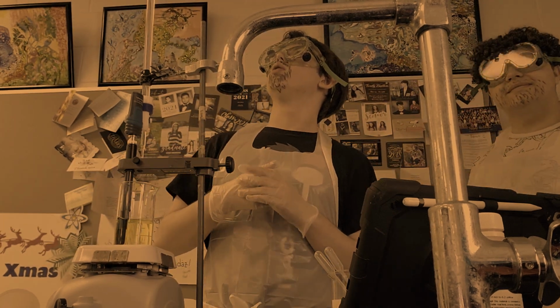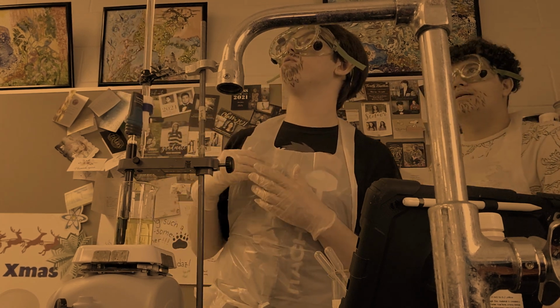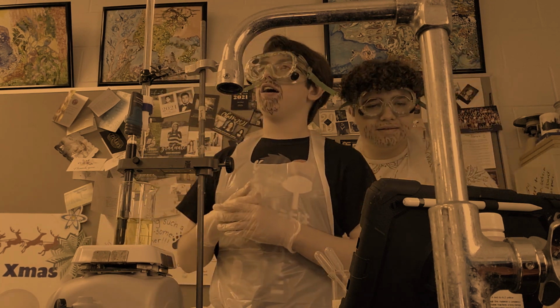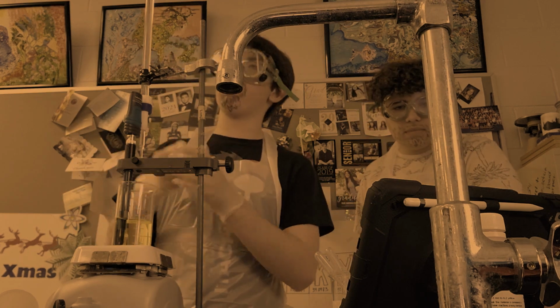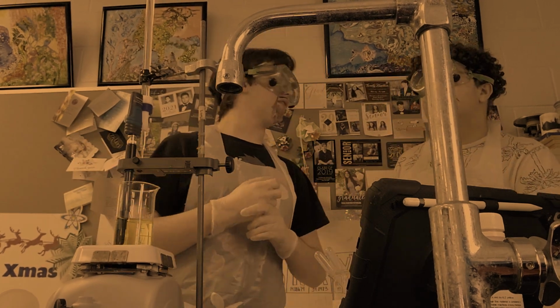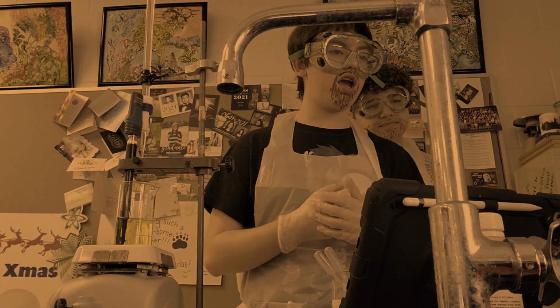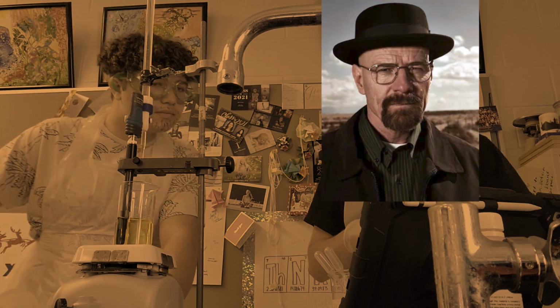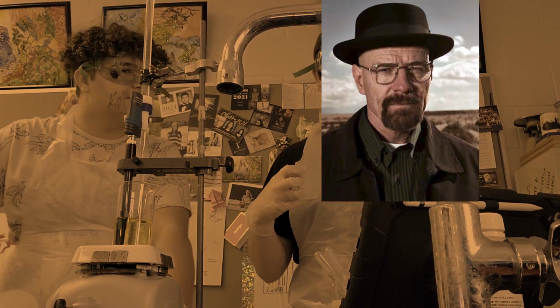And so, where we started was at the 10 mark, but now we're at the 24 mark. Wow. That's a lot. So, currently, we've dripped down about... We're nearing the 15 milliliter mark. And so, if we are looking here, that is roughly a little over our half equivalence point.